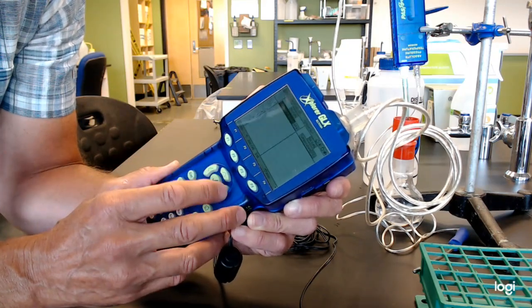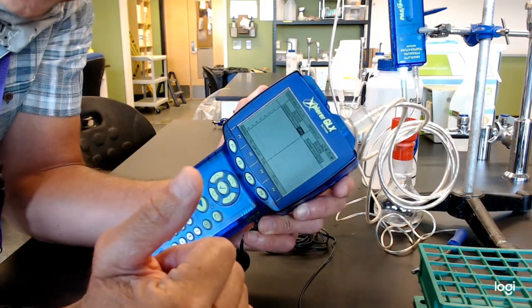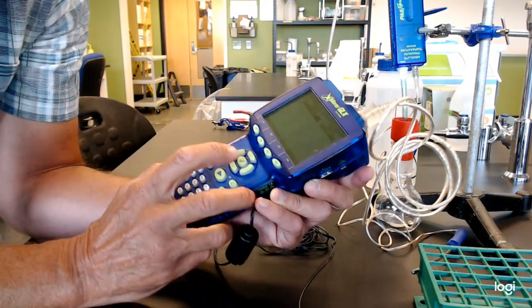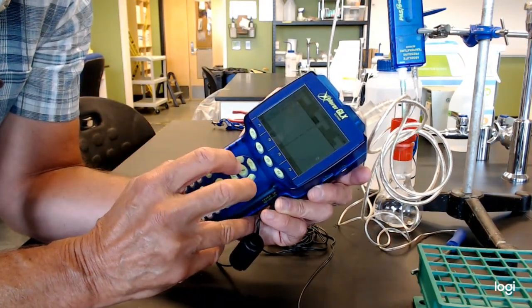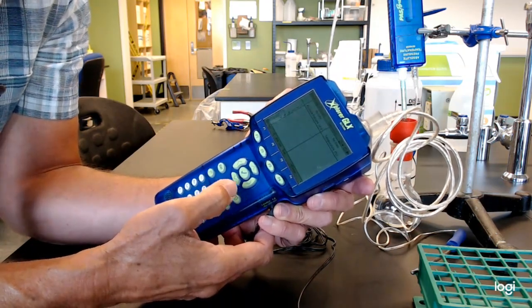Don't worry about that, though, because you can also take all the data and then change the units after the fact. So this data logger doesn't just lock it down in one unit, and then you can't change it back. So we're actually ready to start taking data.